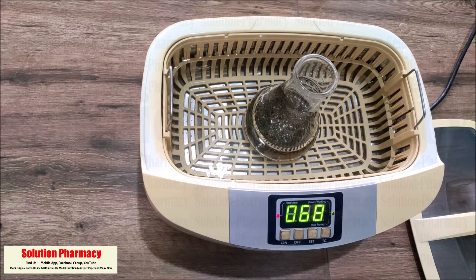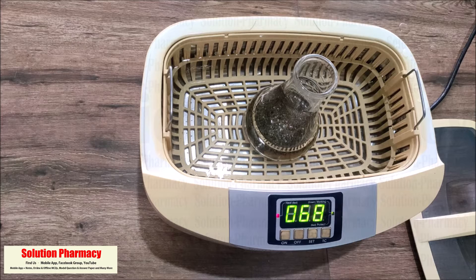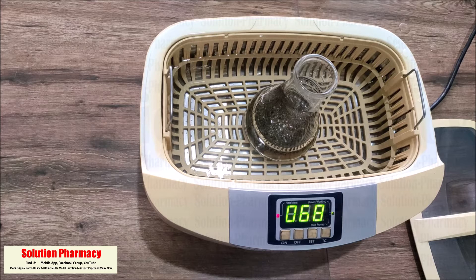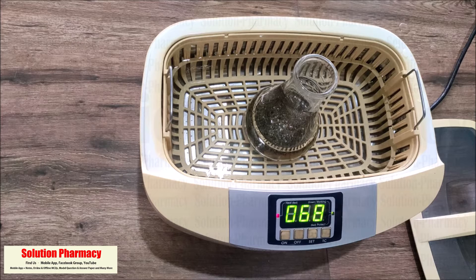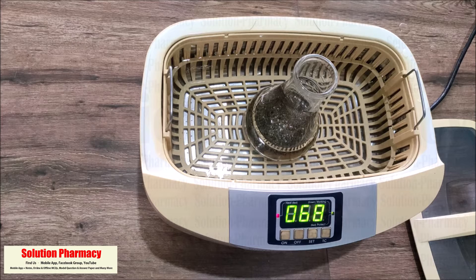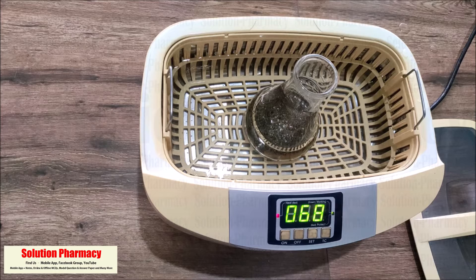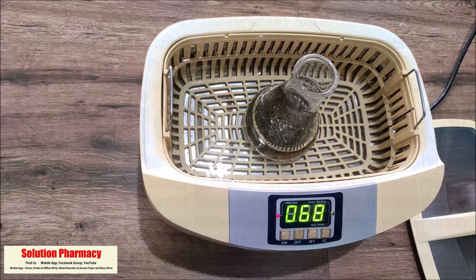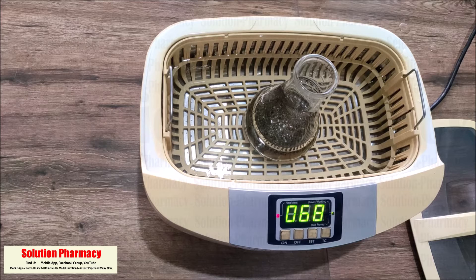First of all, let's look at the different parts of the ultrasonicator. The instrument used for sonication extraction is called a sonicator, and as explained in the lecture video, there are two types commercially available. The first is the probe type, which is directly inserted into the sample for extraction — that's why it is called the direct sonication method, and it is the most common method. The second type is known as the bath type, also called the indirect type of sonication.